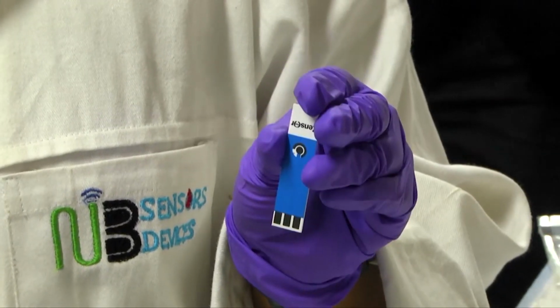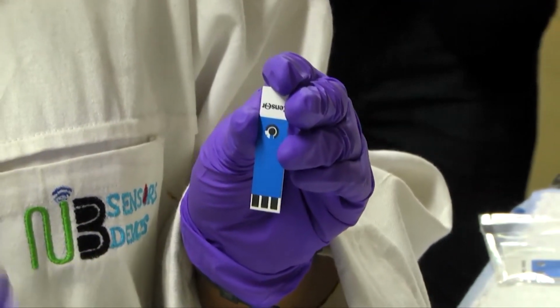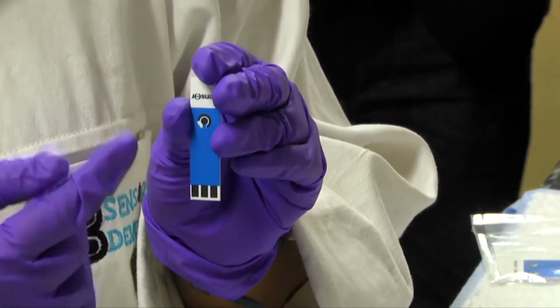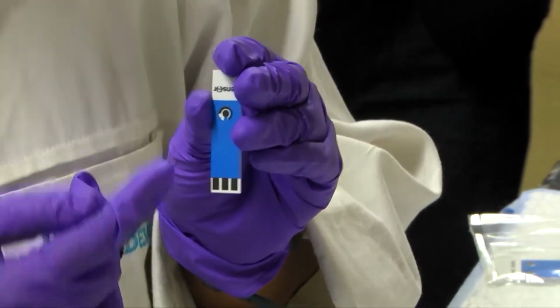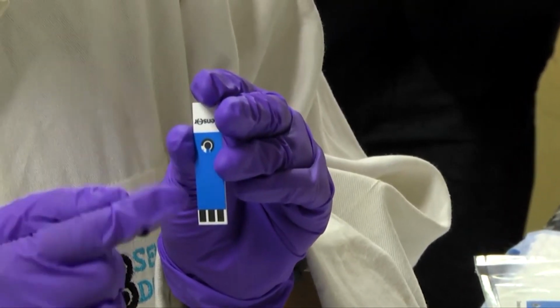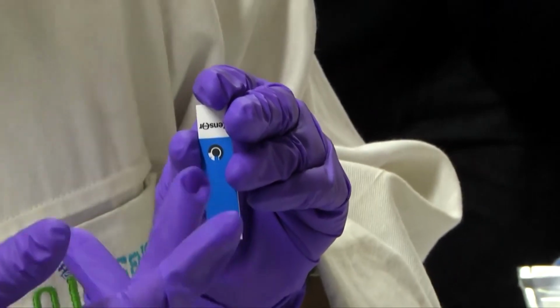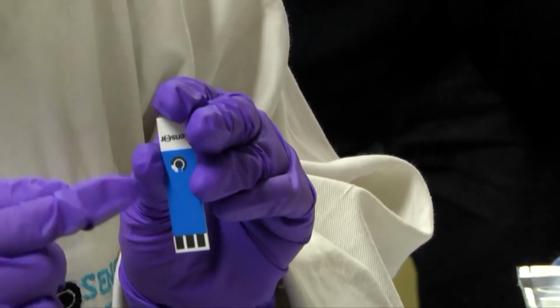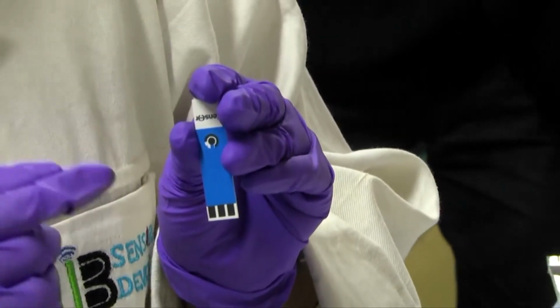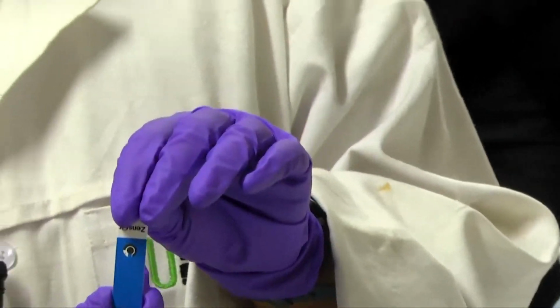So this is another kind of electrode, a screen printed electrode, where all 3 electrodes are printed. The circular part at the center is the working electrode, followed by the larger semicircular part, which is known as the counter electrode, and the small dotted grey portion that we are seeing is the reference electrode. So this is the complete setup of the SPE.